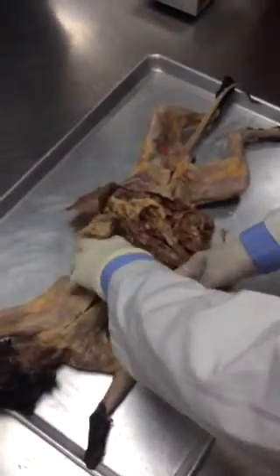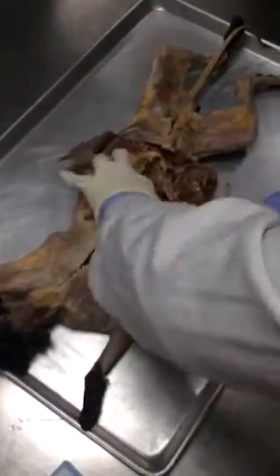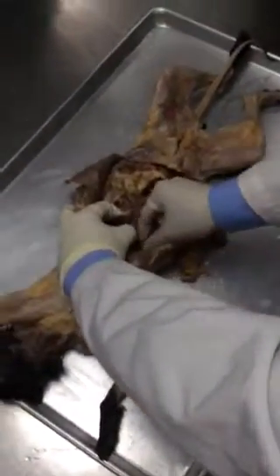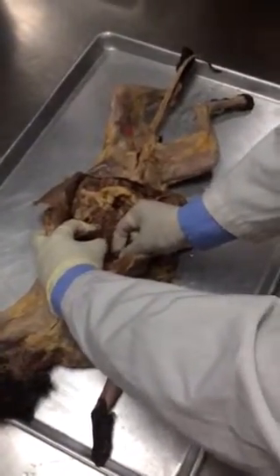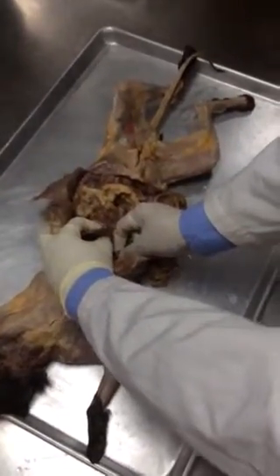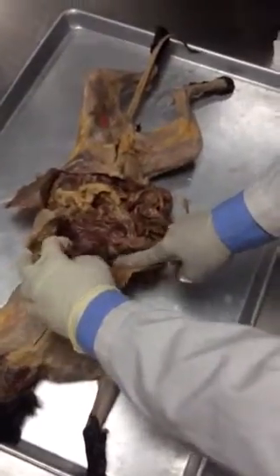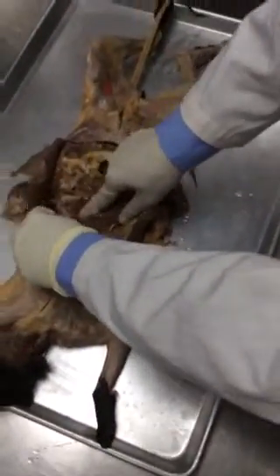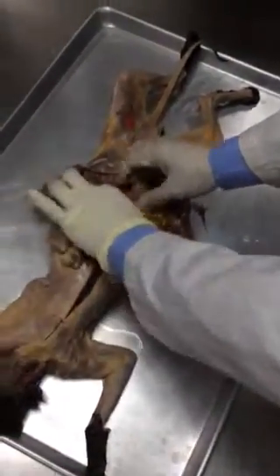Liver has got a gland underneath, and let's try to find out the gland. Here it is. It is not a gland really, it's a sac. Can you see, can you feel something in the sac? This is the gallbladder. Alright, this is the gallbladder. Can you see the gallbladder? Here is the gallbladder. Now what else you see? You see the spleen, alright? Can you see the spleen right here?